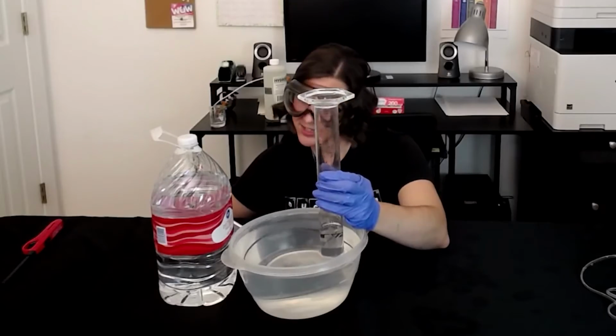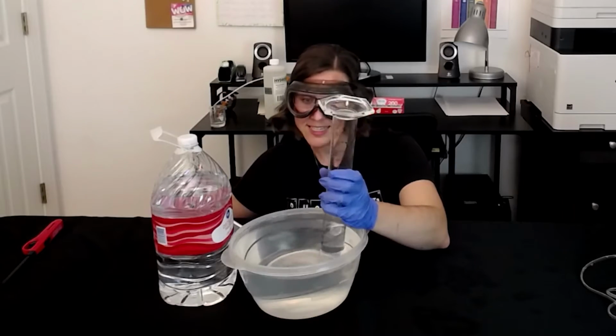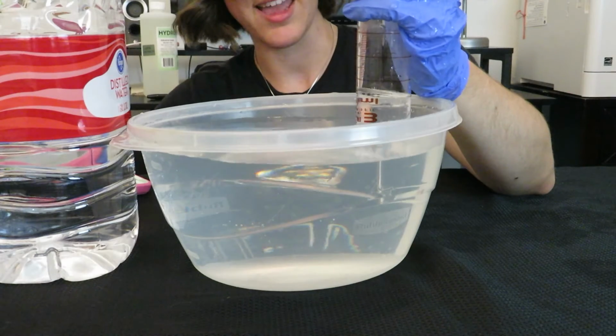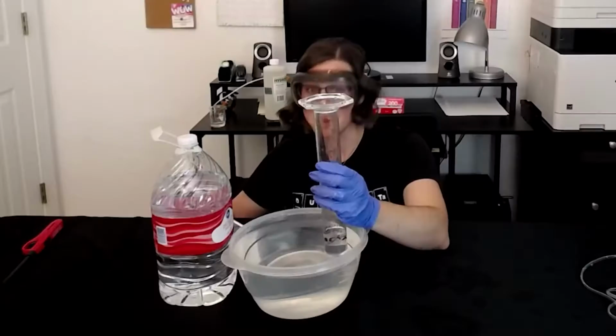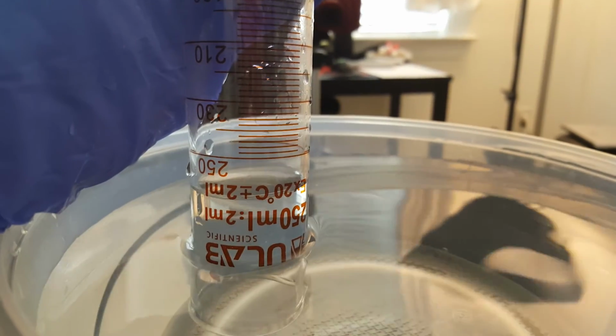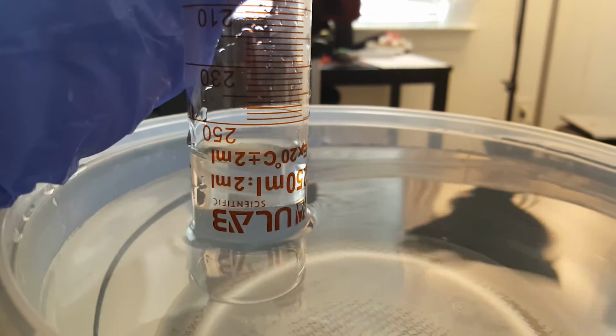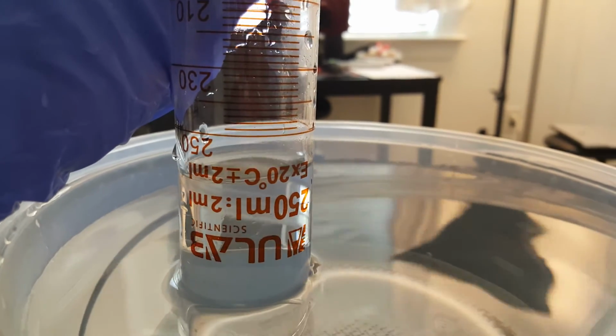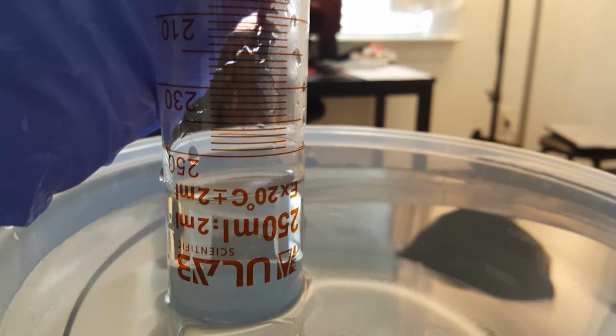This is where it gets a little tricky because we're reading this meniscus from the upside down inverted graduated cylinder. Just keep that in mind. We're going to have to take our final reading minus the initial reading of the little air pocket that was in the top here. So we overshot our collection of gas by, looks to me, maybe another 15 milliliters. Let's say 15.